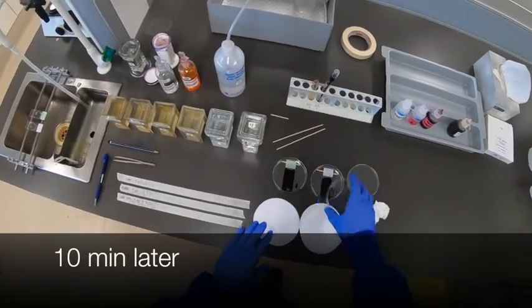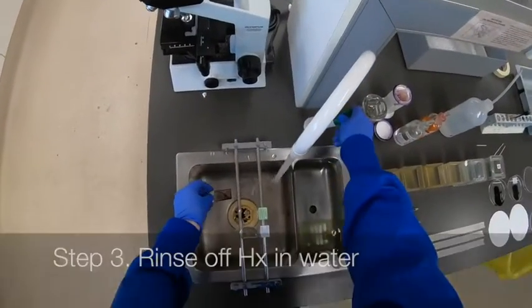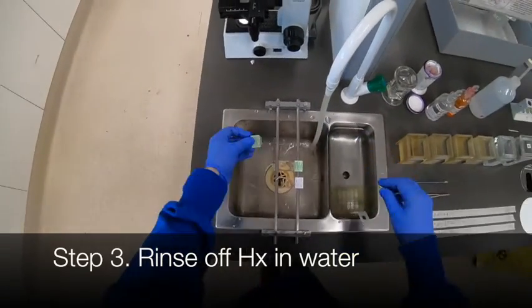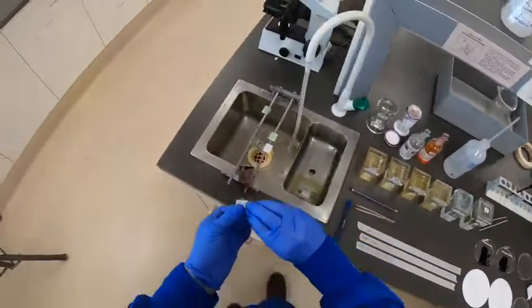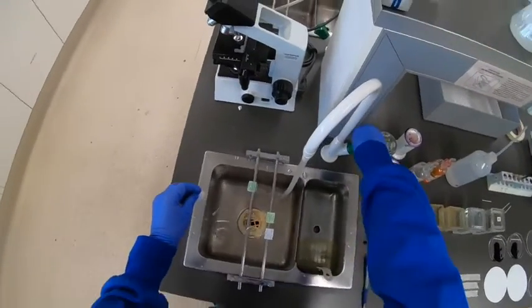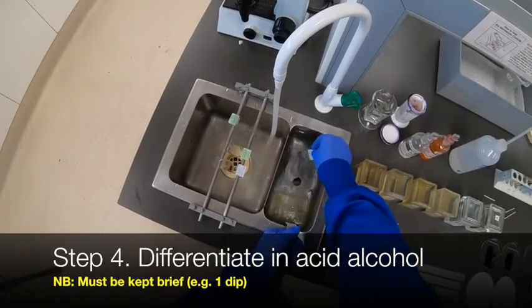After 10 minutes, rinse that off as you would normally do after staining in other hematoxylin solutions — best to rinse in the sink rather than straight into the smaller bath. Now, this type of hematoxylin with the iron mordant is designed to be more resistant to removal from the tissue under acidic conditions, but we still need to give it just one dip in the acid alcohol.